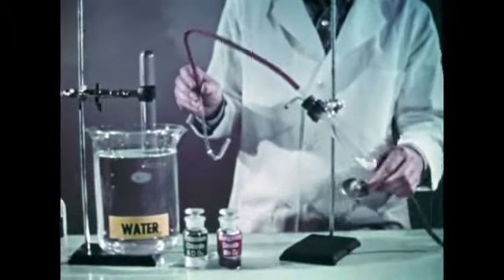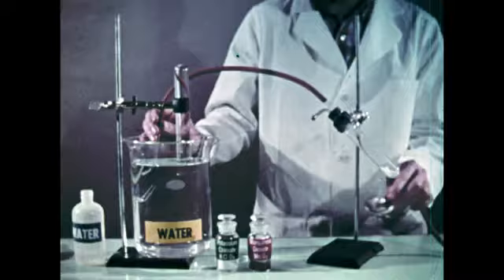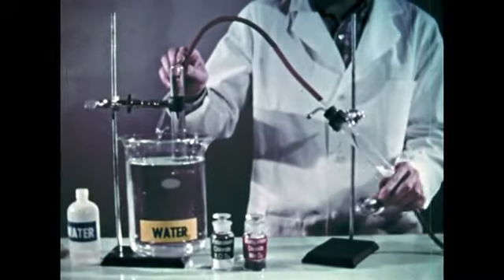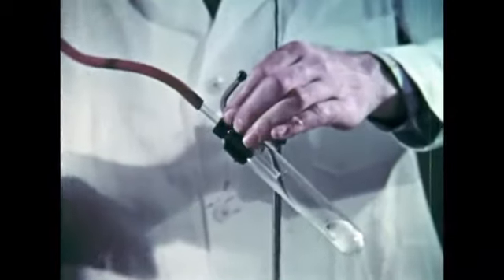Now the potassium chlorate is heated gently to get the air out of the delivery tube and to show that you won't get much reaction before adding the catalyst. Of course, if you heated the potassium chlorate well above its melting point, it would break down into the products potassium chloride and oxygen. But the catalyst saves both time and trouble. So now we'll add the manganese dioxide from the delayed filler bulb, and you'll see an immediate reaction.